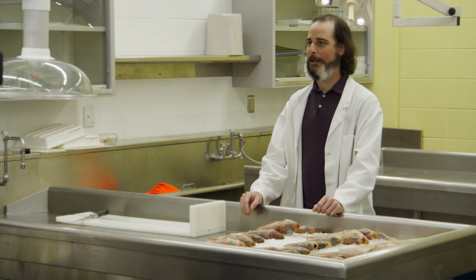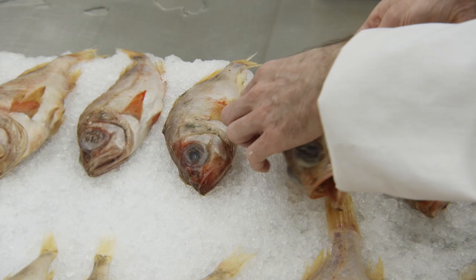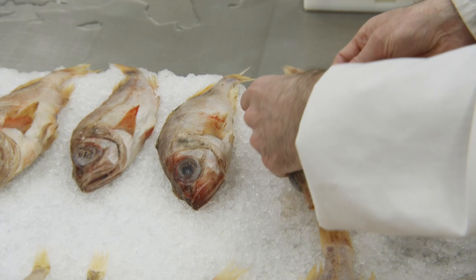Fortunately, without having to identify all of them, we can assess the proportion of both species in a catch by using a subsample and by observing a small physical characteristic: the number of anal fin rays.